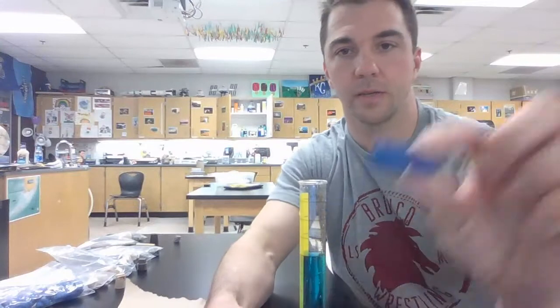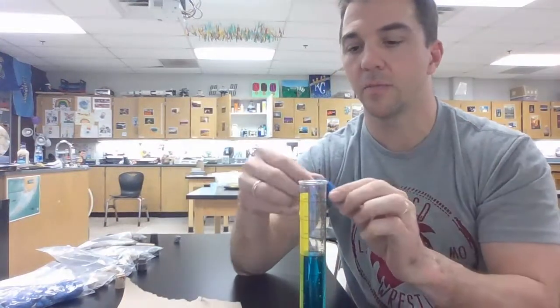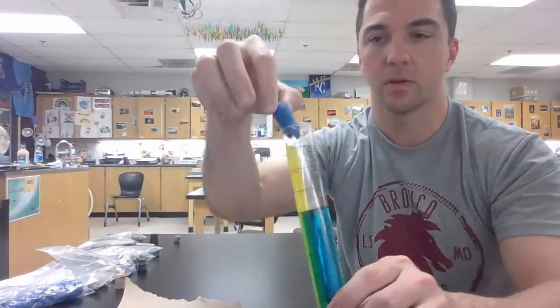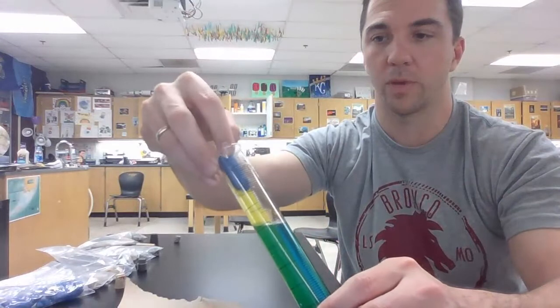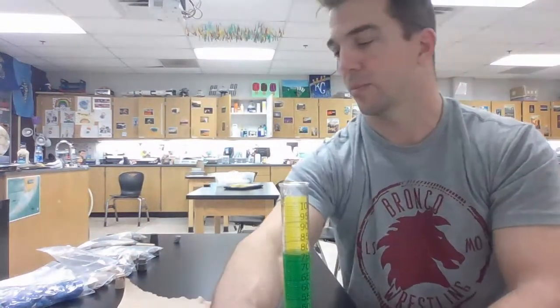Third one on our list is the piece of clay. For all of these, it is the same exact piece that I used when I measured the mass, otherwise that would throw things off a bit. So lower that in. Like always, we were at 70, and there you can kind of see where we're at. Hold up a little bit more. So measure that volume. Make sure you subtract the difference and record that for the clay sample.